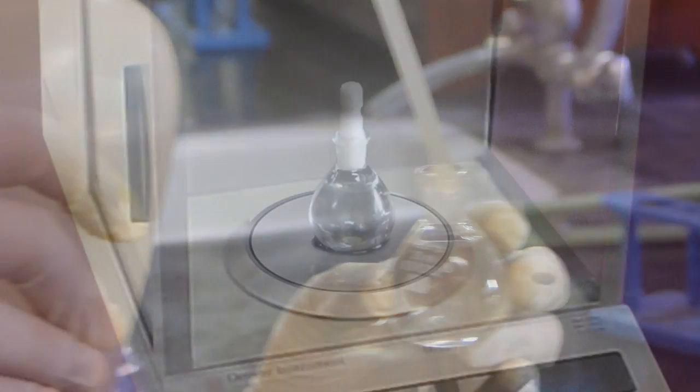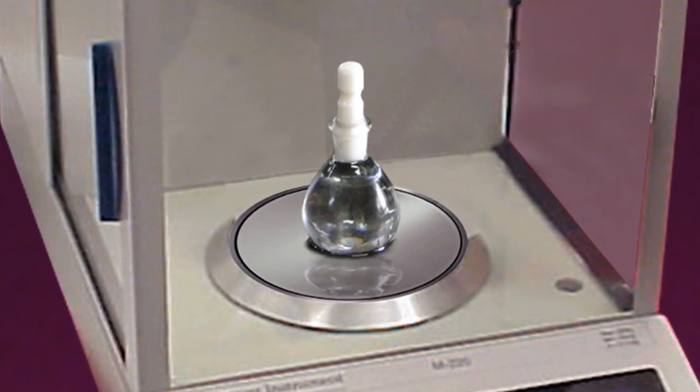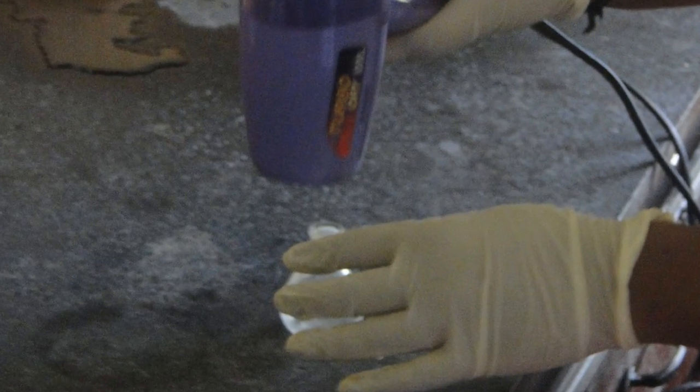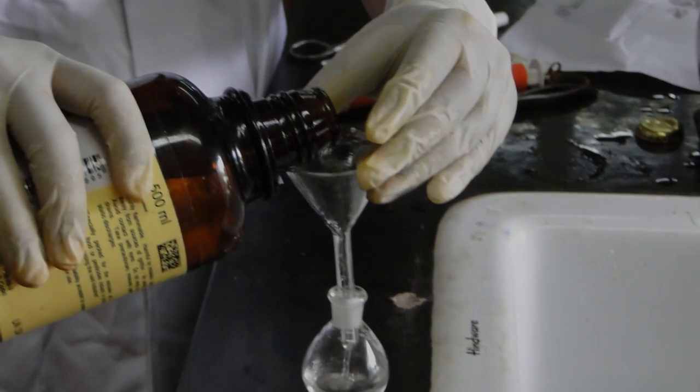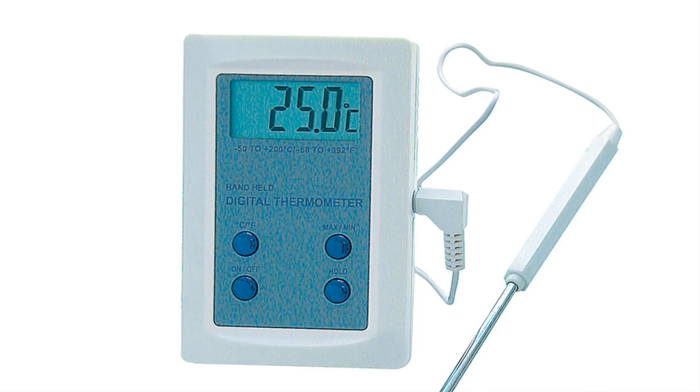Then fill it with distilled water and weigh. Remove water and dry. Then fill it with experimental liquid and weigh. Note the room temperature also.